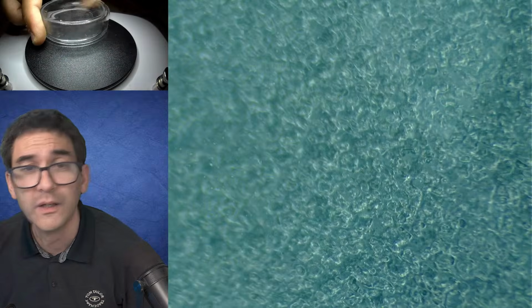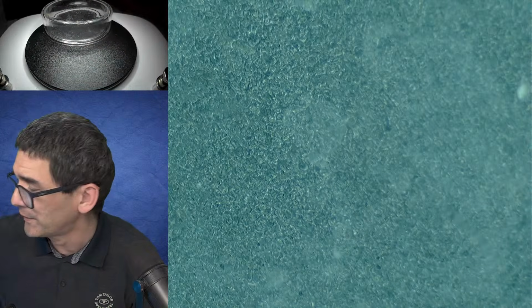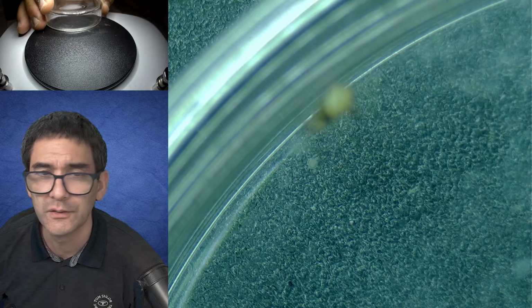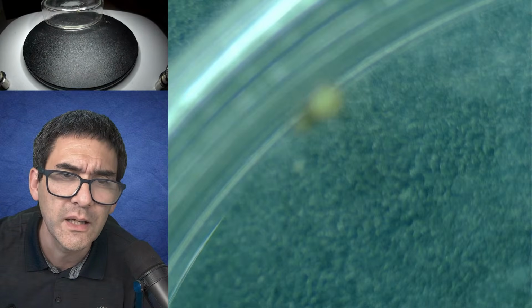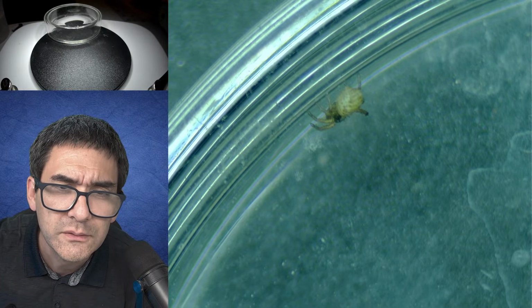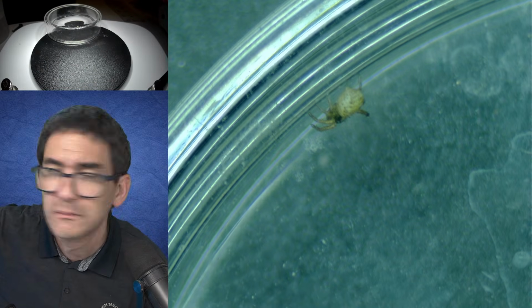Basically, let me always start with a low magnification. Together with the plant I found, where is it? I found this here, and of course I had to immediately have a look at it. There are two spiders in here. This one is actually not looking at me.